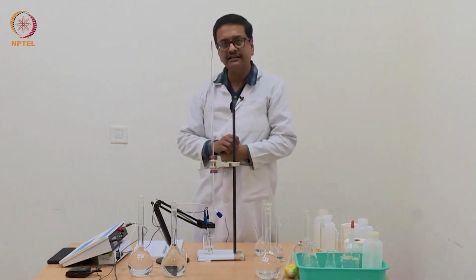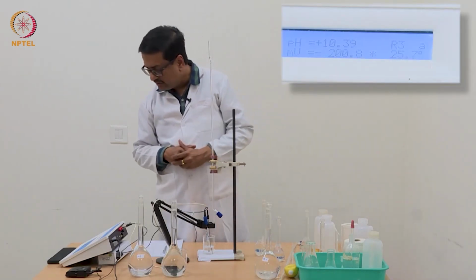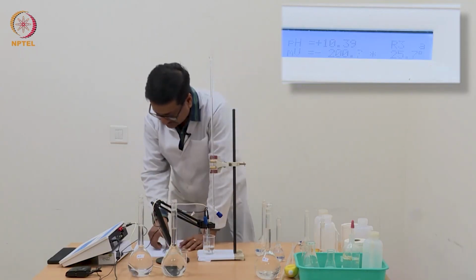So now I have added just 0.02 ml of NaOH to end this titration, and the pH is 10.39.